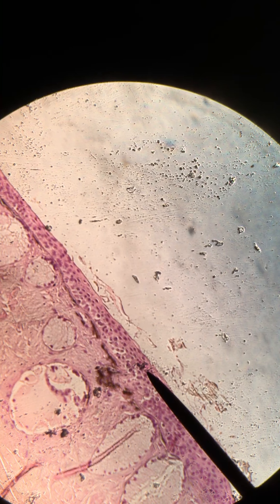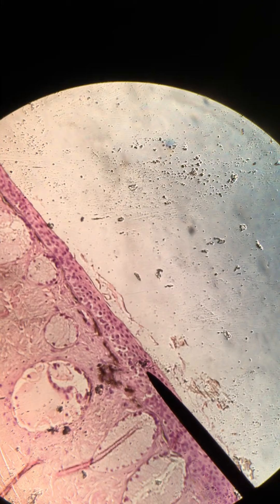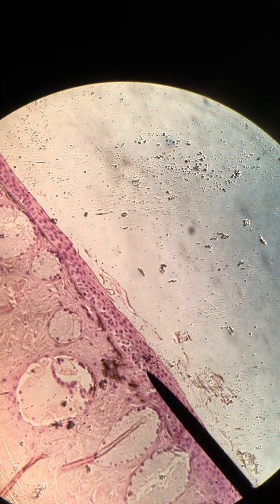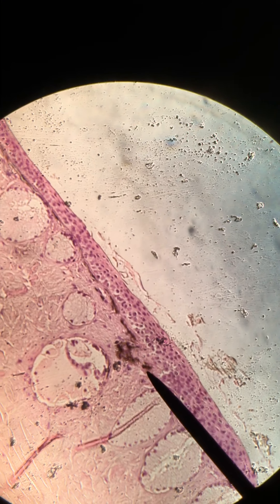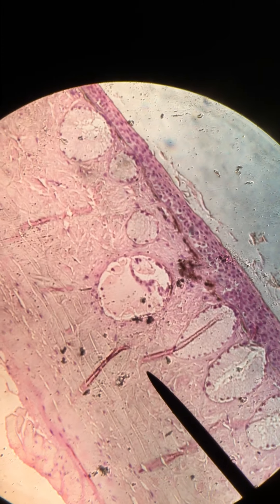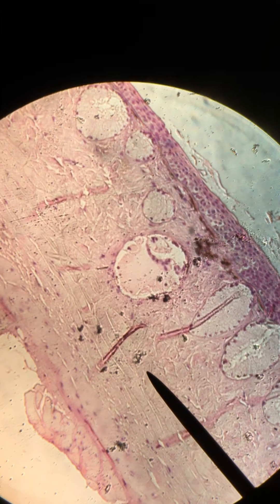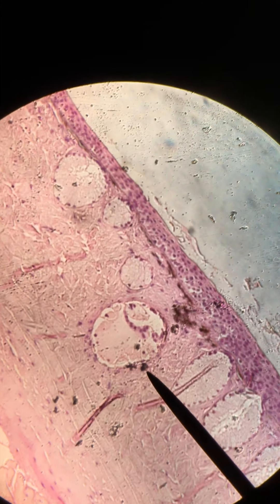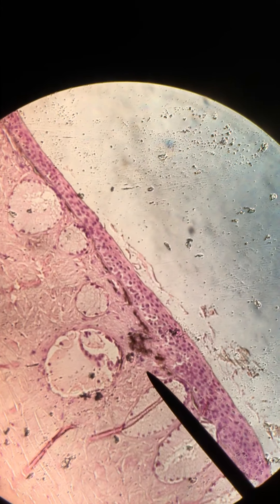Now we are going to zoom in on this to see it a little bit better, but I'll point it out just before we do, just so you can orient yourself a little bit. And then all this in here — this pink fiber stuff — this is going to be irregular dense connective tissue, so all this stuff here.